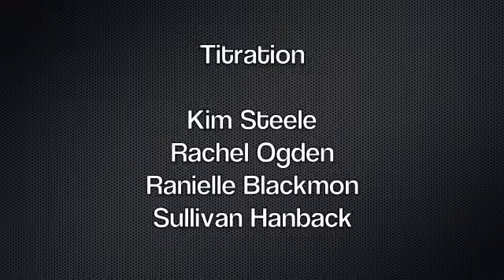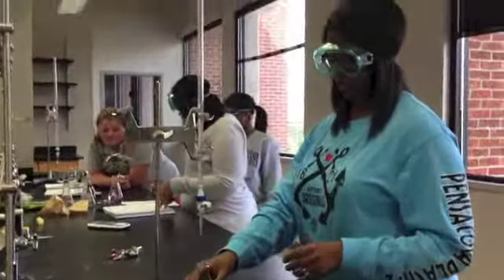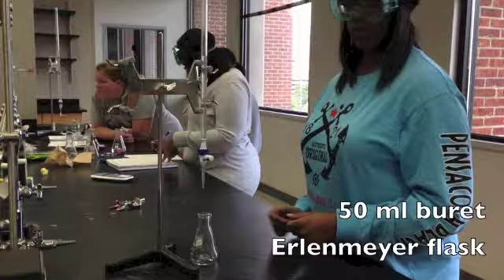Titrations are used to determine the concentration of an unknown solution, the stoichiometry of a reaction, the number of electrons transferred in a reaction, and solubility products. Before you begin the titration, you must check the glassware for cracks or chips.